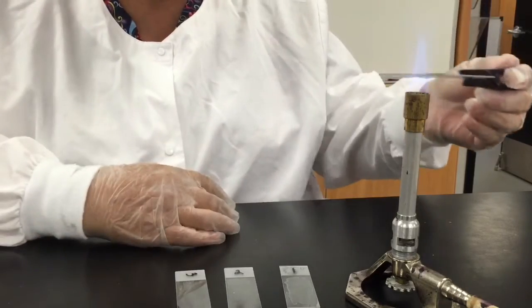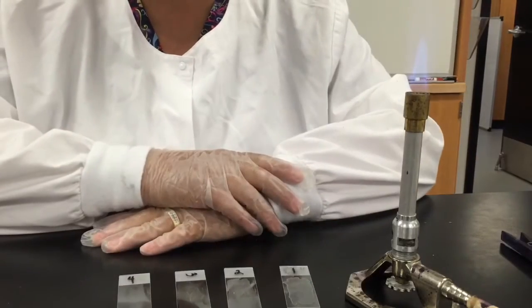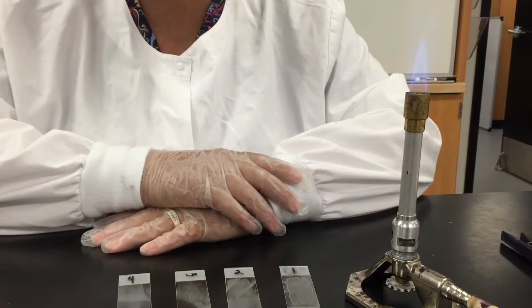Okay, so here we go, heat-fix, these slides are ready to stain, and I will show you how to do that in the next segment. Thanks.